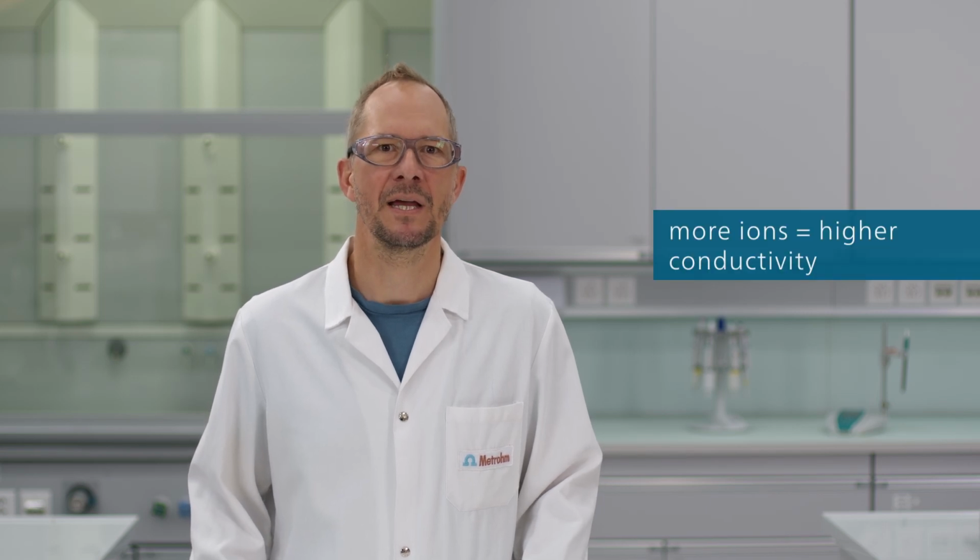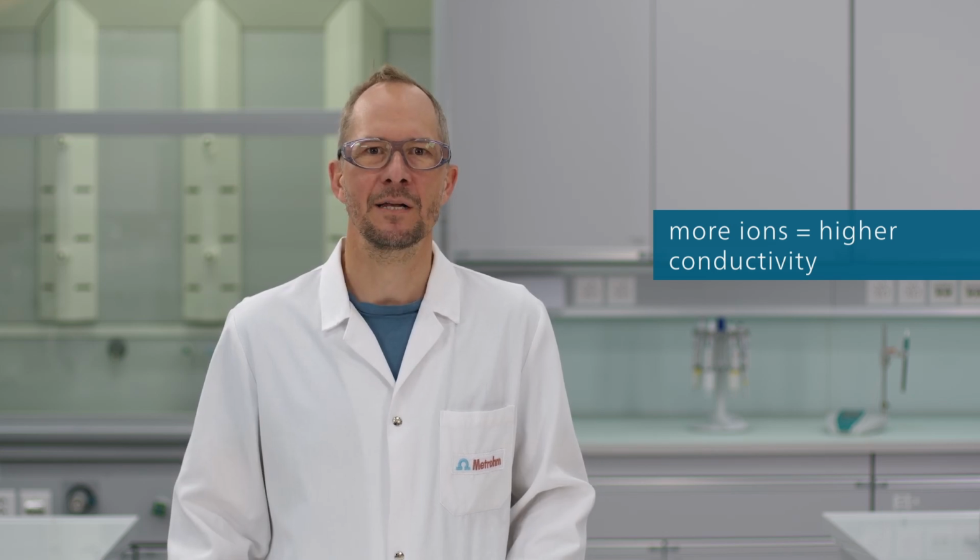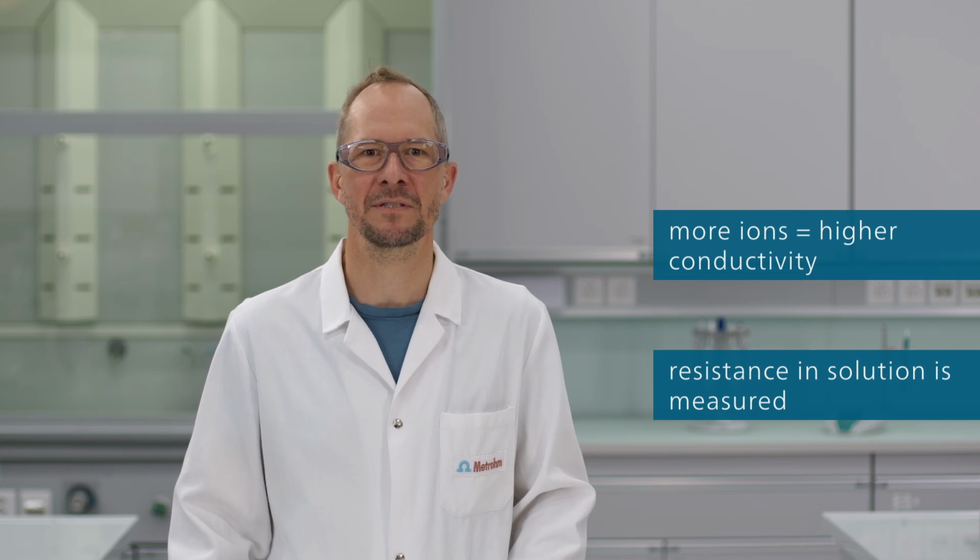Conductivity measures a solution's ability to conduct electricity. This depends on the concentration of ions. The more ions present, the higher the conductivity. To determine this, a measuring cell passes an alternating current through the solution and measures the resistance.